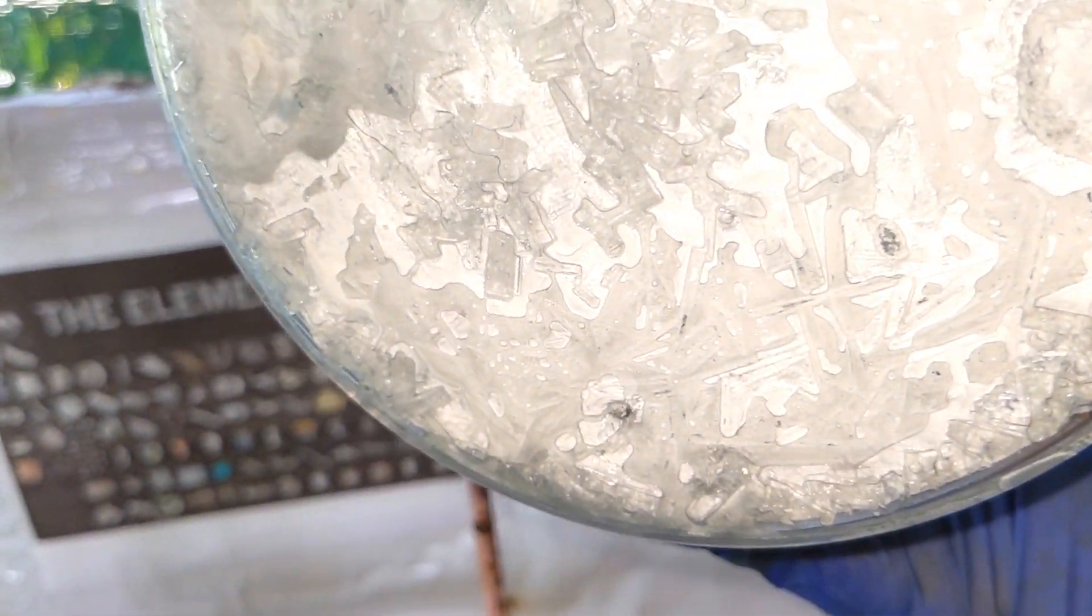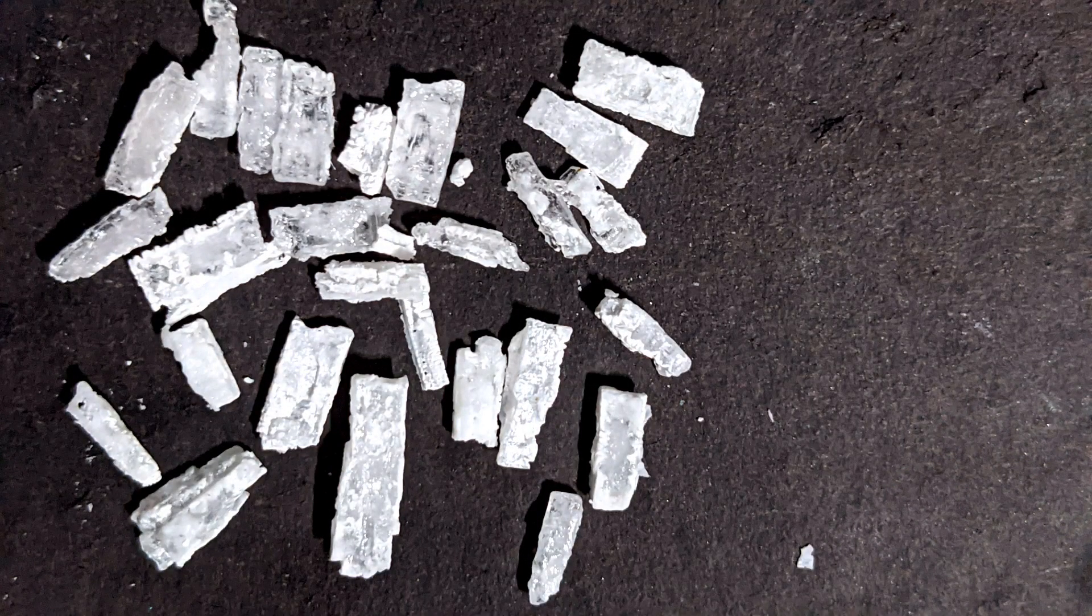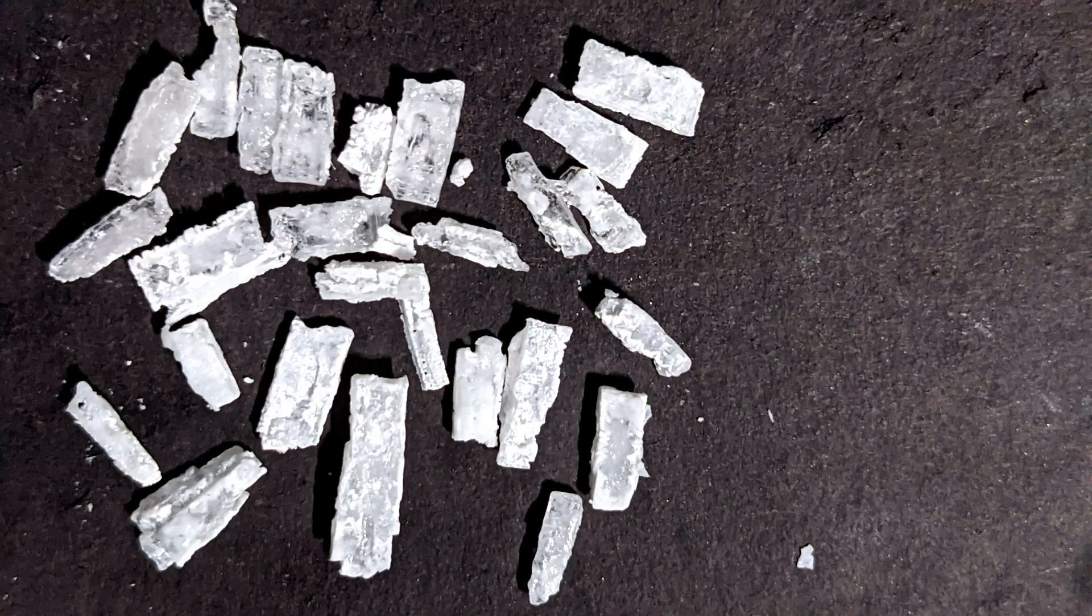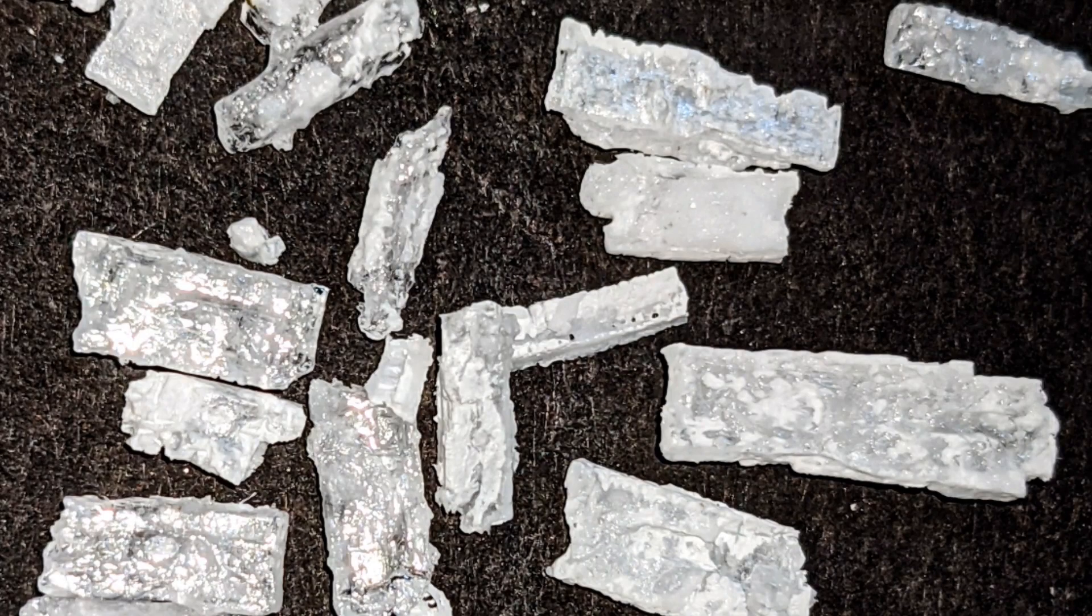So I tried my best to separate out some of the crystals and these are the crystals that I obtained after carefully separating out some of the crystals from the crust. You can see the monoclinic arrangement.